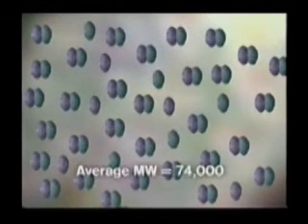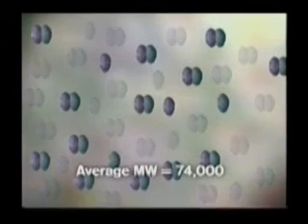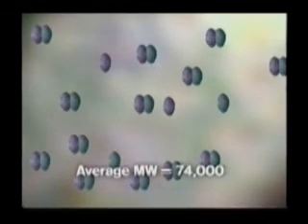Our experiment reveals something else about STF-7A. The average molecular weight of the particles doesn't change over the range of concentrations generated by our experiment. This means that almost all of the STF and 7A molecules are complexed even at extremely low subunit concentrations. In fact, for the percentage of STF and 7A molecules present as complexes to be significantly reduced, we would have to dilute our samples by more than 100-fold to a concentration so low it can't be measured with our equipment. This tells us that the association between these 2 molecules is very strong indeed.